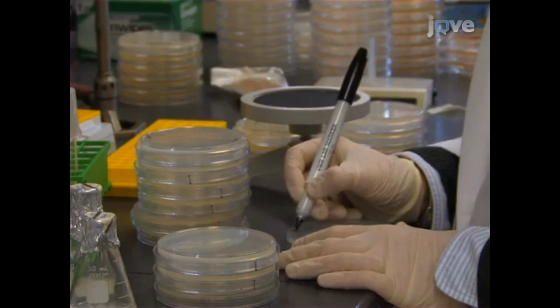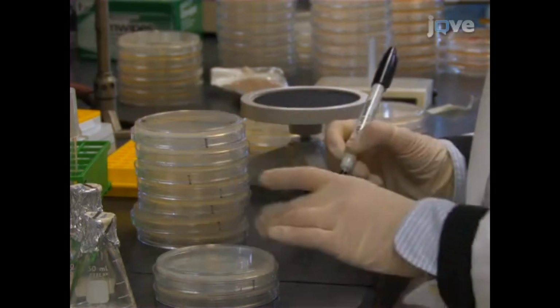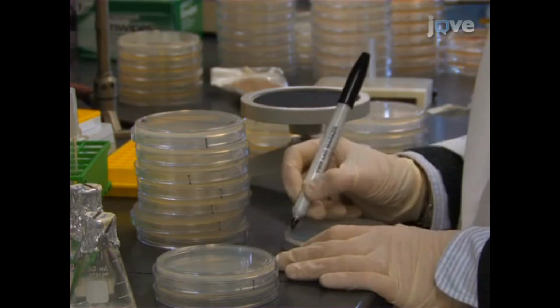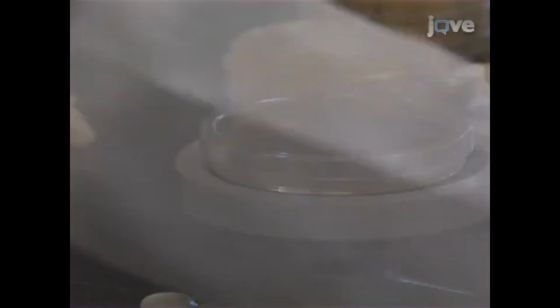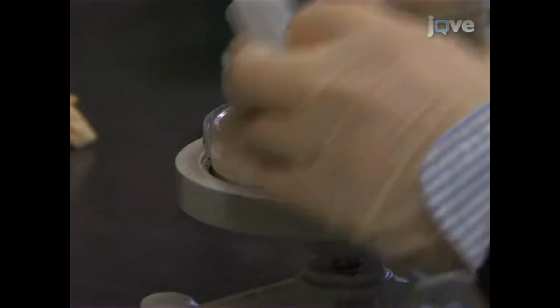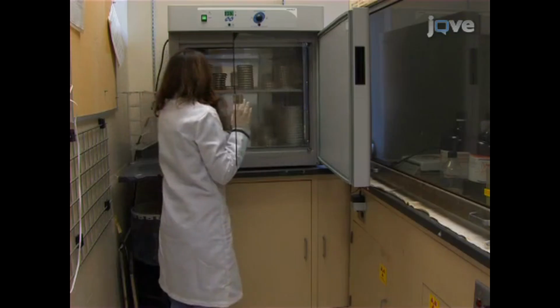For each strain, prepare a set of 8 to 20 tryptophan dropout SDC plates labeled according to plating density to ensure 10 to 100 colonies can be counted in anticipation of decreased viability during aging. Plate 2 aliquots of 10 to 30 microliters of diluted culture onto each plate. Incubate the plate set at 30 degrees Celsius for the duration of the lifespan analysis.